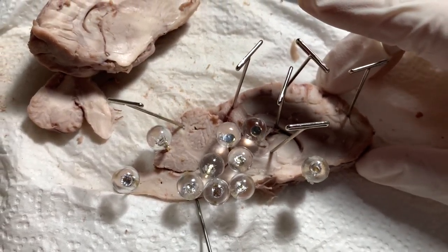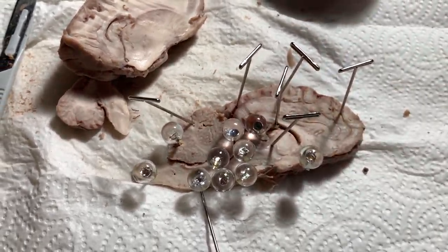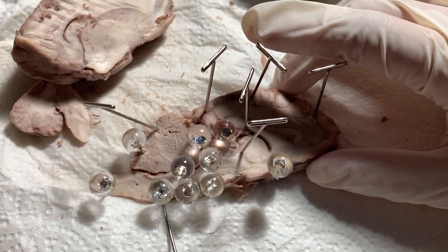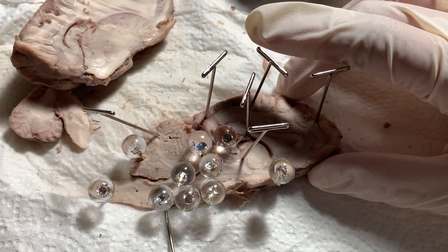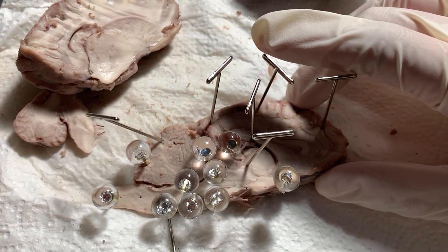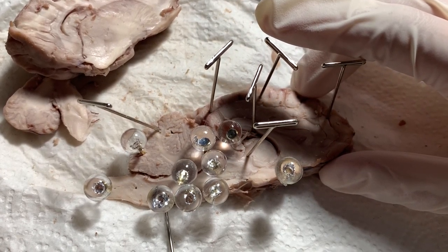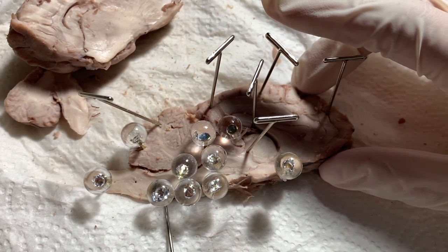Next we have the medulla oblongata. The medulla oblongata's objective is to help maintain blood pressure and heart rate at normal levels. An example of this would be the pyramidal decussation, where criss-crossing of the brain's body control occurs — the left side of the brain controls the right side of the body and the right side of the brain controls the left side of the body.